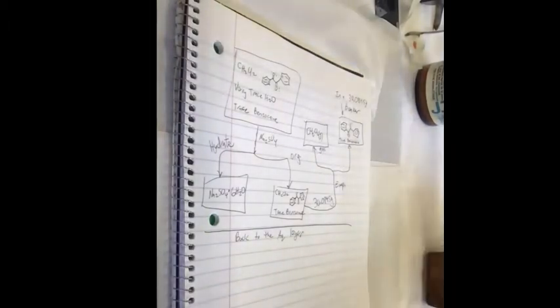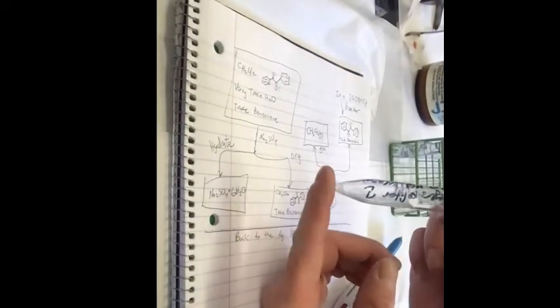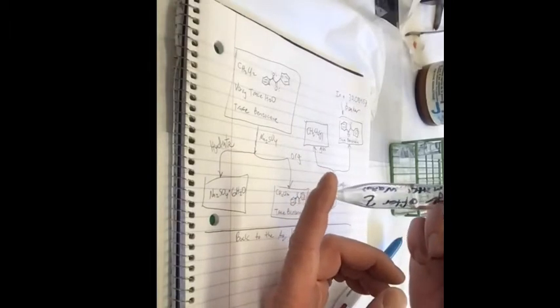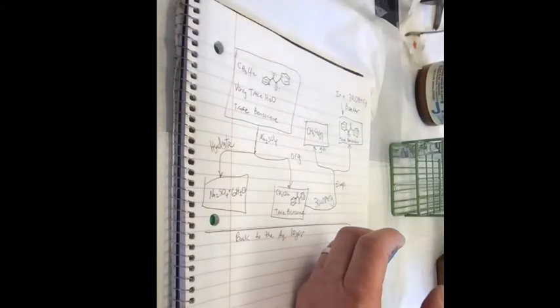So if you remember the aqueous layer, we had 2. Okay, now see, this is where labeling helps. I was looking at this and I'm like, man, there's not a lot of precipitate in there. Oh yeah, that was the organic layer brine wash. Okay, that's the brine wash.